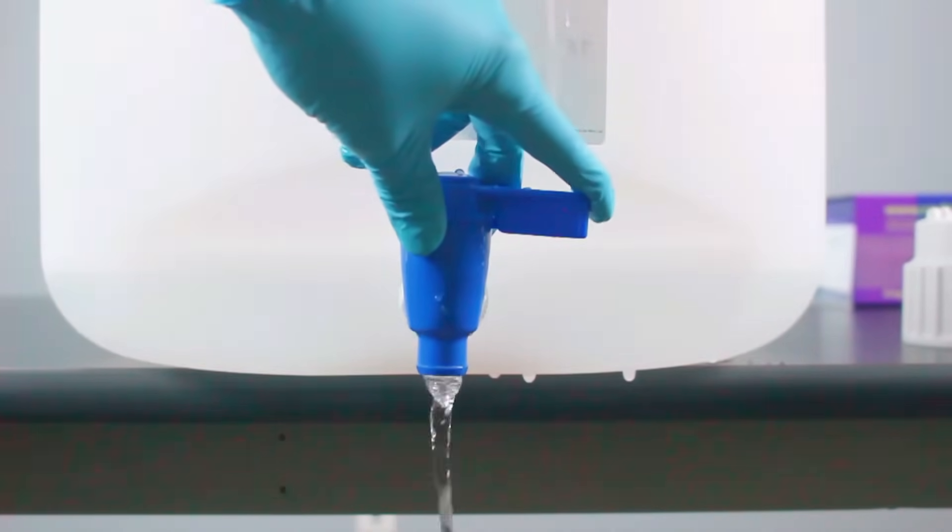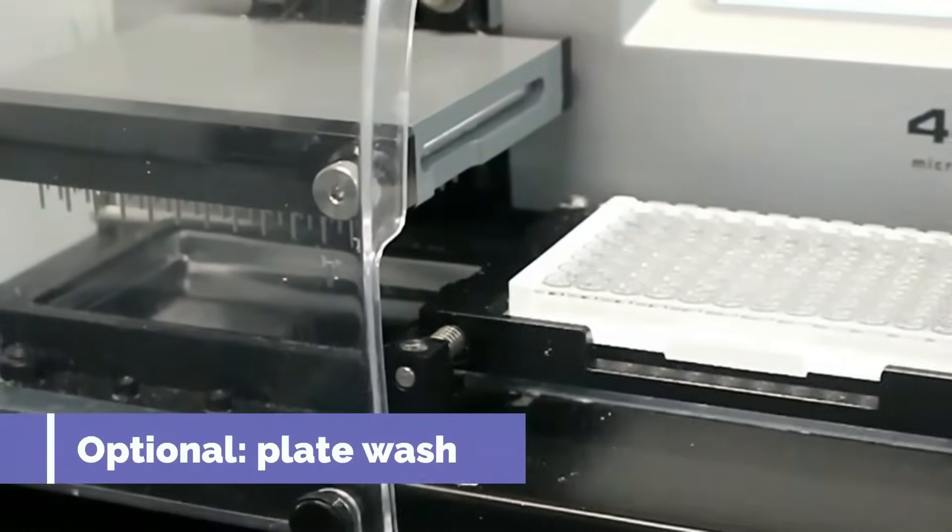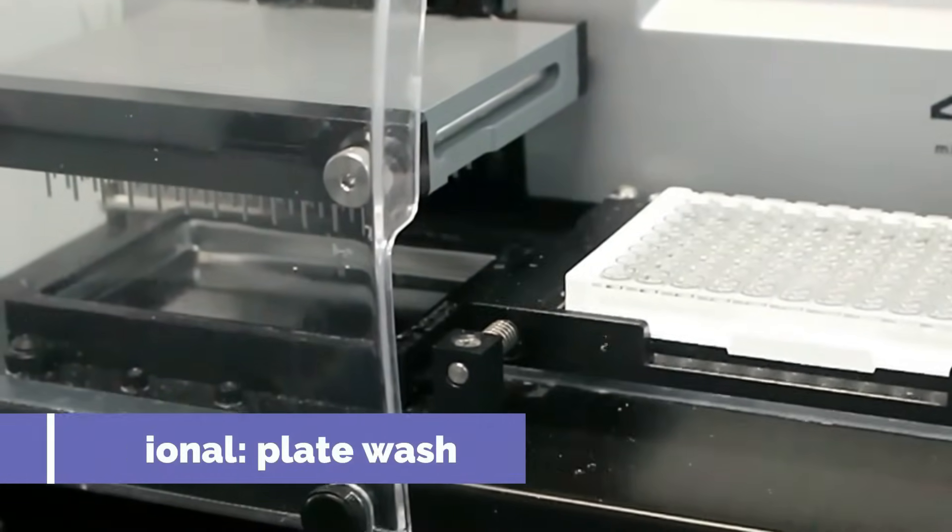Deionized water will be used to dilute concentrated buffers. Most ELISA labs will have a plate washer. We will demonstrate hand washing if this is not an option.